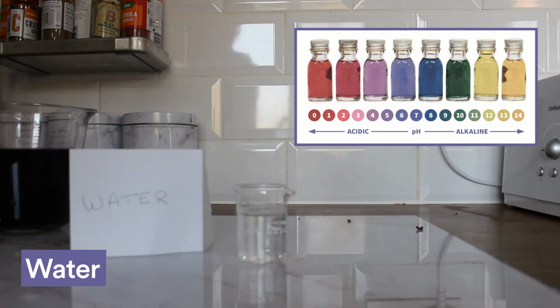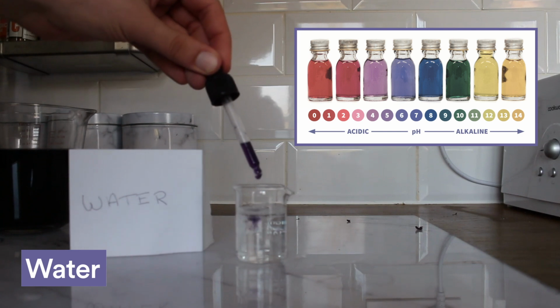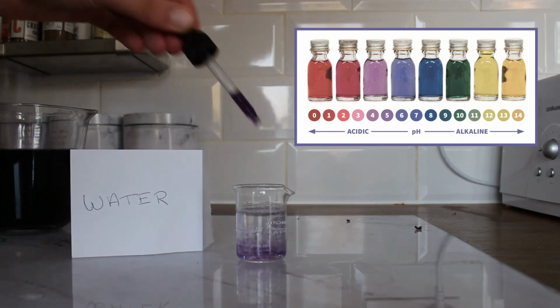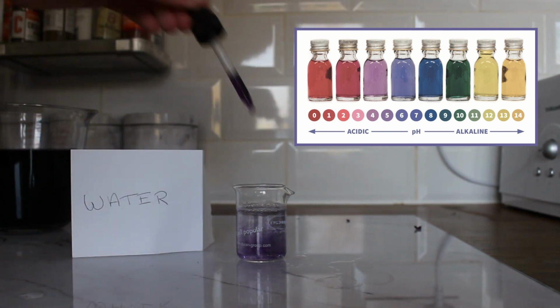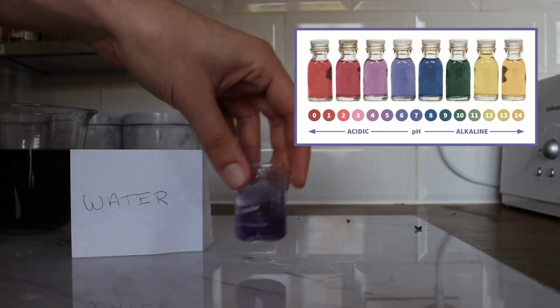In the beaker here, I've just got some water that I've got out of the tap. As I add the indicator, you can see that the indicator just mixes with the water and doesn't really do much here. This means that the indicator isn't indicating anything, which means water isn't an acid or a base. It's actually something that we call neutral, which means it's neither an acid or a base.